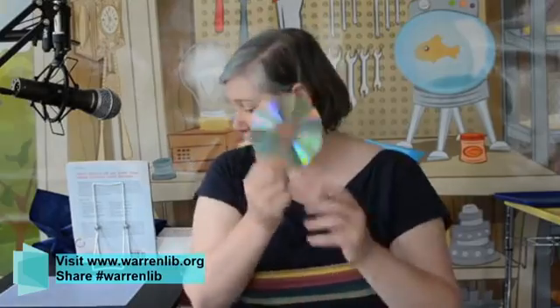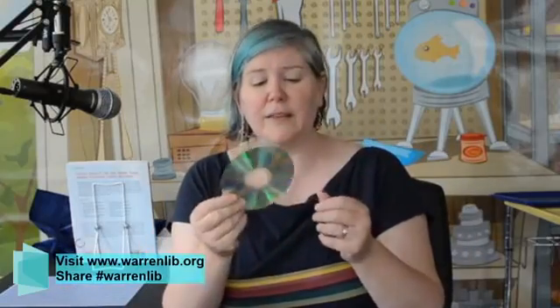You're going to need an old CD. And I'm just going to make sure I have my questions back up here, just in case. So you're going to need an old CD, like this one. We're interested in this side, so you want something that doesn't have a whole lot of scratches on it. An old DVD works. You could usually find these around.